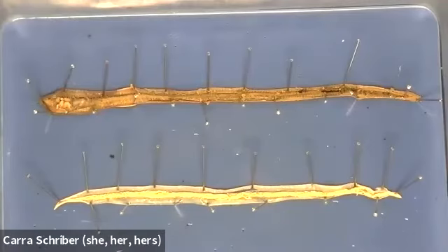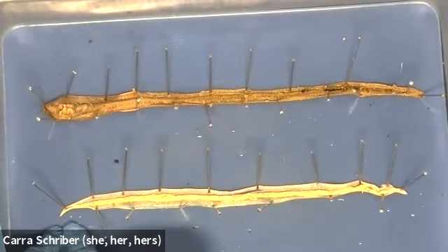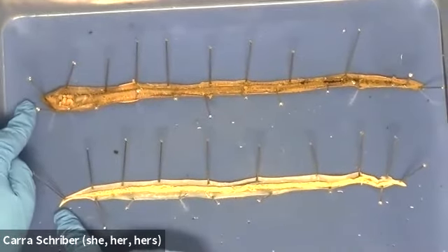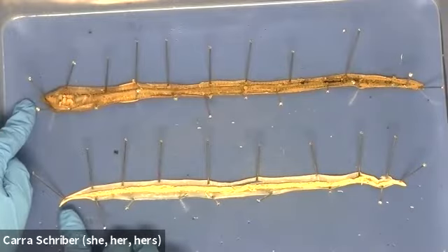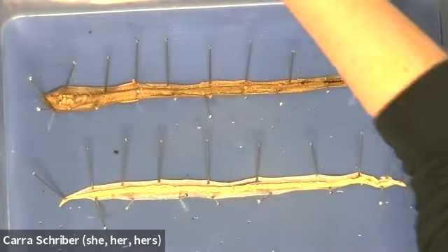All right, so I'm back with you, and I have opened up the ectoderm for both our roundworm and our earthworm. And once I opened up this roundworm, from the internal components, I was able to confirm that this is the mouth end. So I did correctly orient these two. Like I said, it's kind of difficult to tell because this thing is pretty simplistic. It's just a sac, but this end is a little bit more blunt, and this one is a little bit more tapered with that pin-like end at the bottom of it. And so I did confirm that.